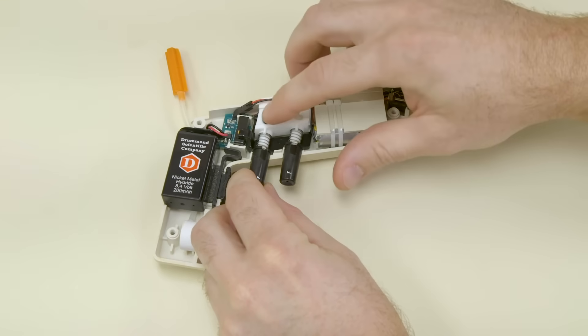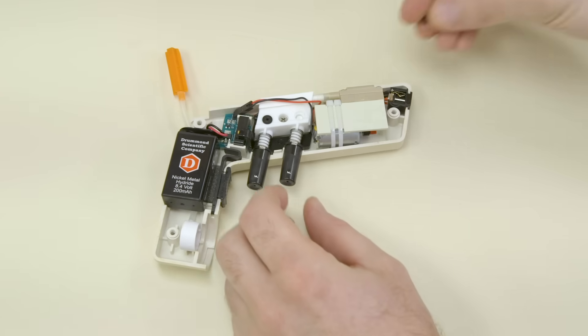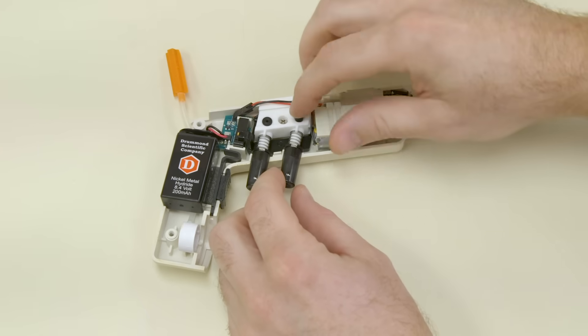Replace the O-rings, making sure they are flush with the valve body. This can be done by having one of the button letters centered and facing you.